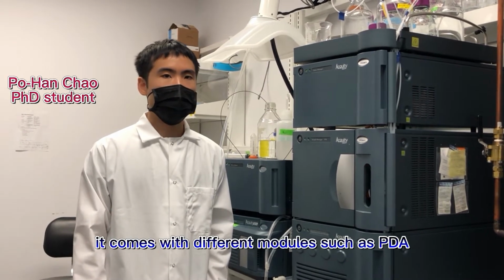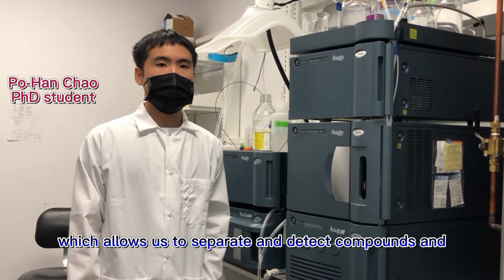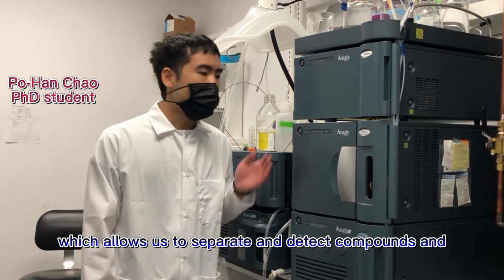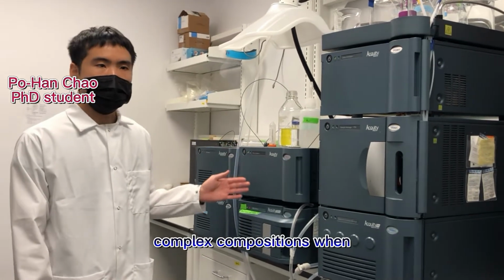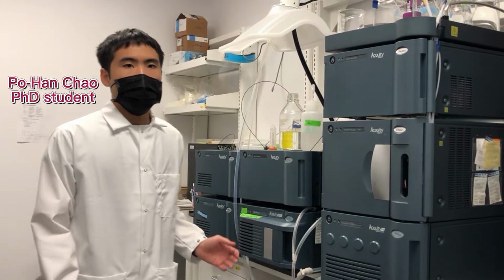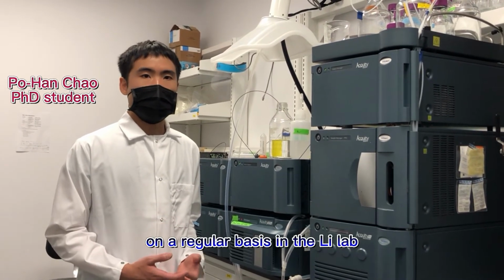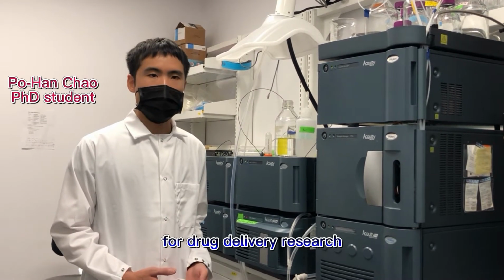It comes with different modules such as PDA and mass spectrometry, which allows us to separate and detect compounds in complex compositions when designing methods specific to target analytes. Overall, this is a capable instrument we use on a regular basis in the Li Lab for drug delivery research.